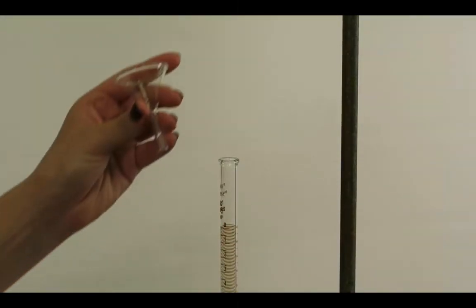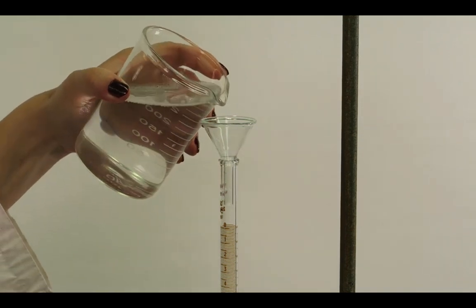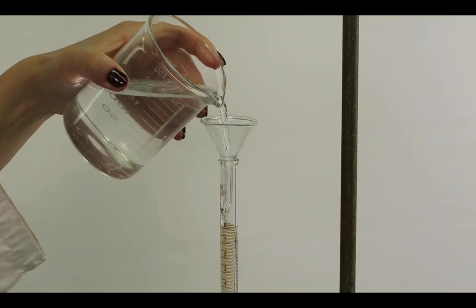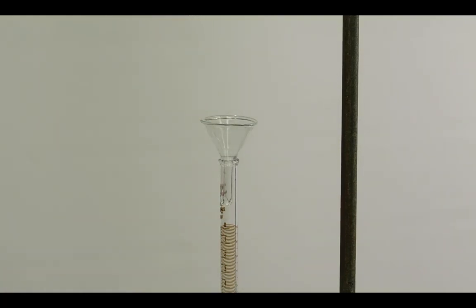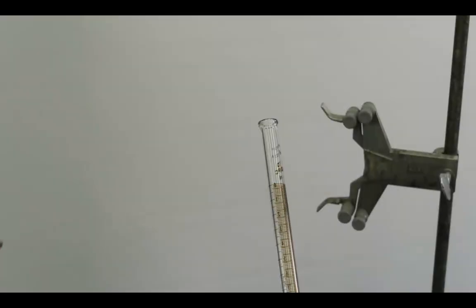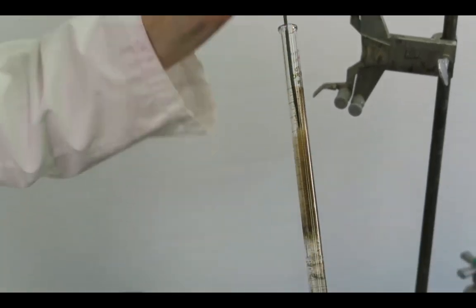If the burette is dirty after several rinses with deionized water, clean with warm soapy water and a burette brush. Fill the burette with warm soapy water. Avoid using too much detergent in the soapy water and never apply detergent directly to the glassware to be cleaned as it will make rinsing extremely difficult. A solution of approximately 2% soap in warm water should be used.